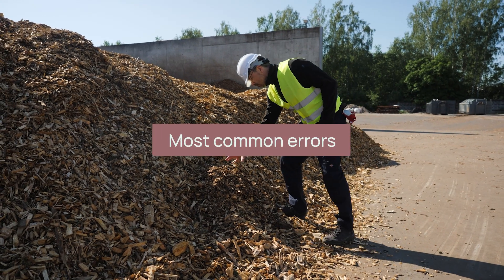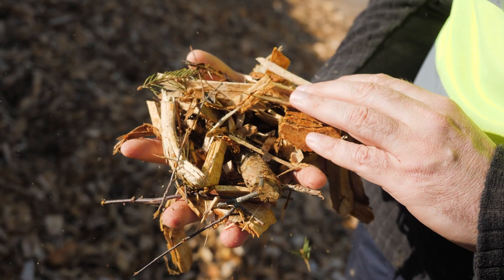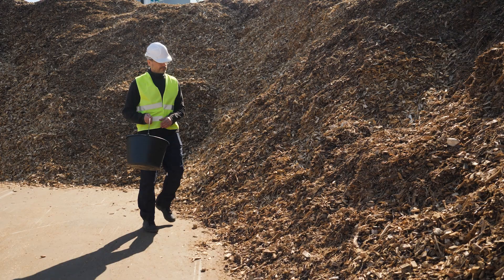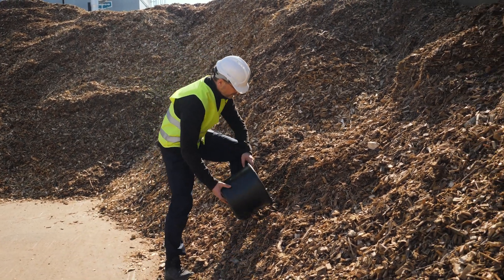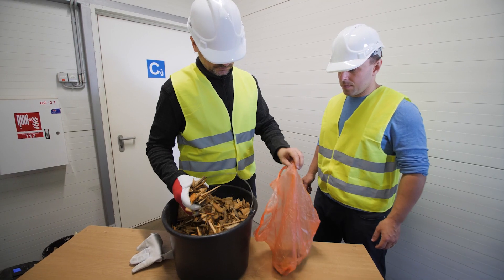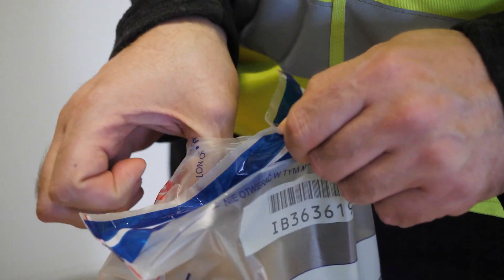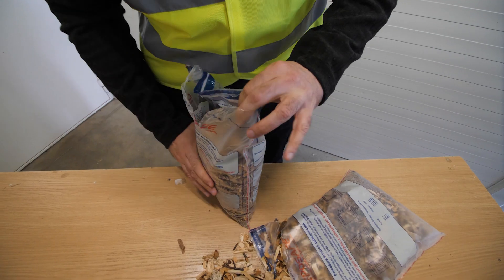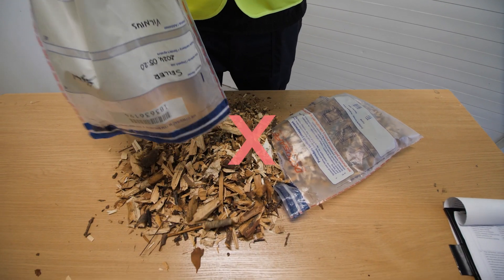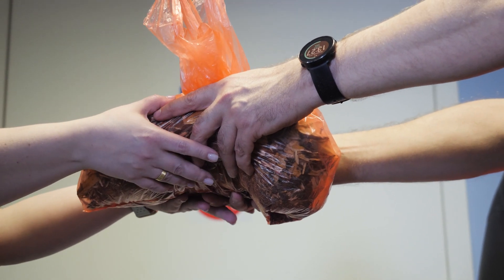The following are the most common errors during sampling which must be avoided: never judge the quality of wood chips based on their appearance, odour, or colour alone; never take samples from a single location or depth of a pile only, or directly from a vehicle; do not take samples by means of tools not compliant with the set of standards; if a sealed container with a sample is damaged, do not form a new combined sample in the absence of the other party's representative; do not deliver samples to an accredited laboratory in non-hermetic or unsealed containers.